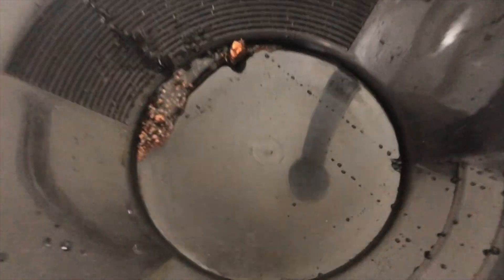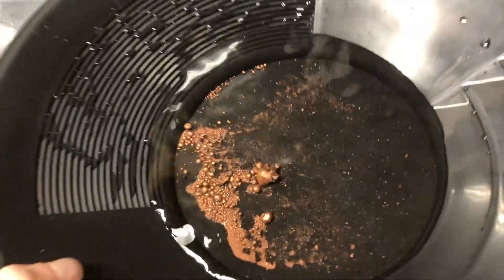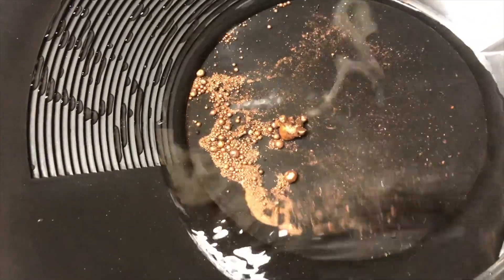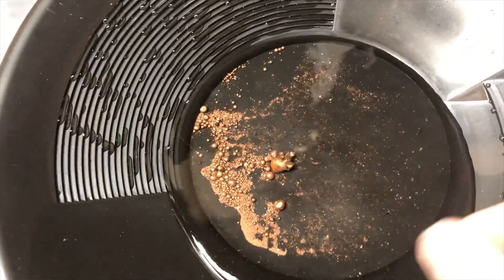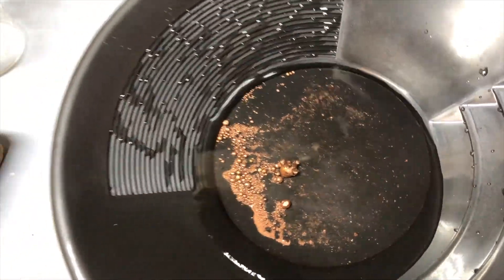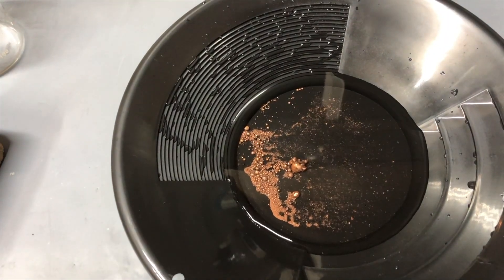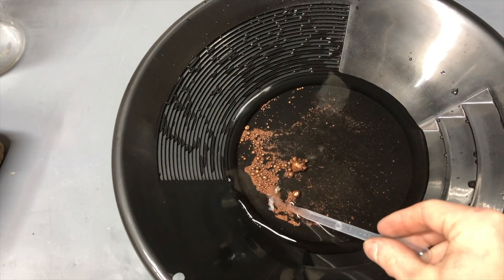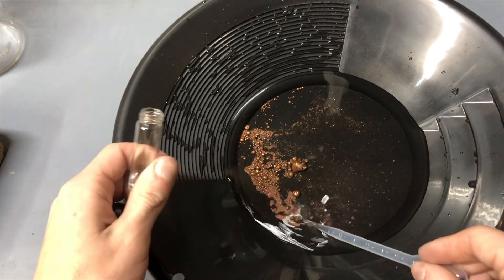In a previous video, I made copper metal. I plan to use some of this copper to produce nitrogen. Now, copper can't produce nitrogen by itself, but it can be used to pull it out of the atmosphere. Being that pure nitrogen doesn't react with copper, but oxygen does. Therefore, by creating a sealed vessel, I can react oxygen with the copper, leaving 99% nitrogen and 1% other gases. This produces a relatively pure sample of nitrogen.